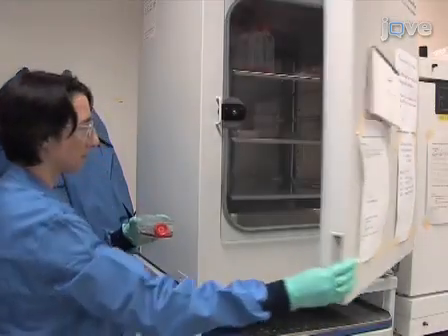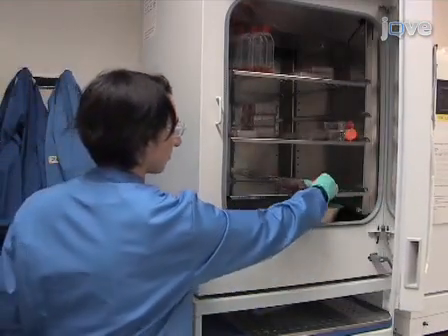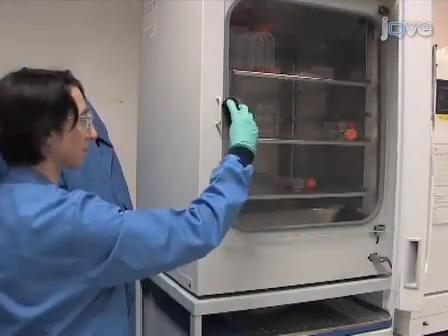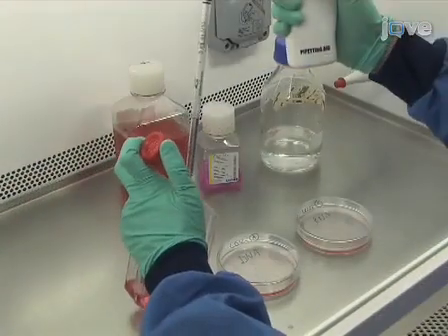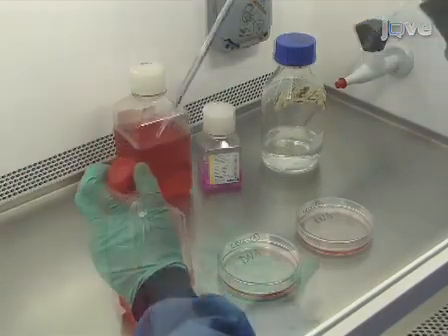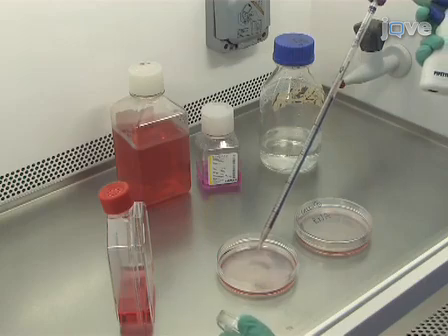After selecting the cell line, culture the cells in a flask according to the supplier's specifications. We will use fibroblasts in this demonstration, although this assay is equally applicable to other cell types, including primary cells. Prepare 2 10 cm Petri dishes for DNA and RNA extractions respectively. When cells reach 80% confluence, they can be harvested for DNA and RNA extractions using standard methods, including commercially available kits that are appropriate to the cell type selected.